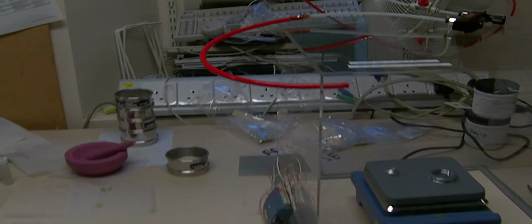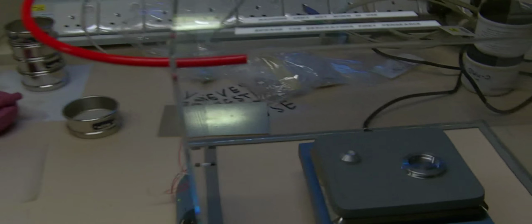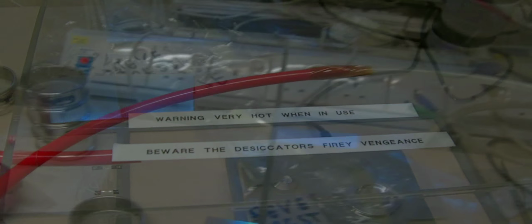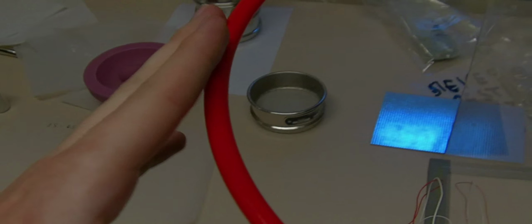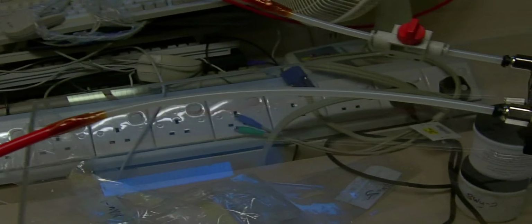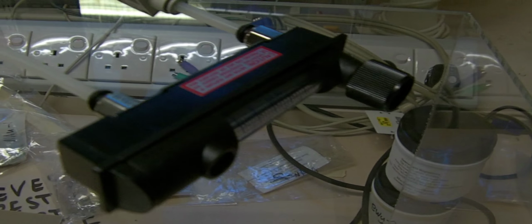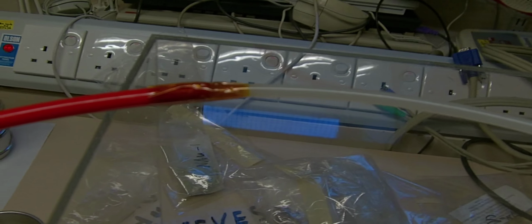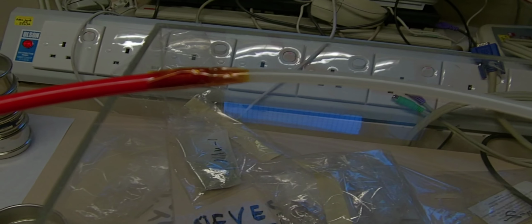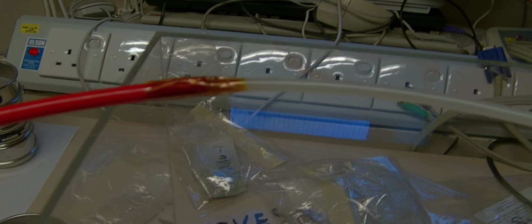Right, so the pipe has now been attached to the desiccator. Oh, and what do you see, I've put a little health and safety message on the desiccator. Now, we had a little bit of an issue because the red pipe I'm using is 8mm in diameter, and I need a 6mm one to go into the airflow tube. So, well, we had to do a little bit of a bodge job just with some adhesive and some tape because we need to start the desiccator today.